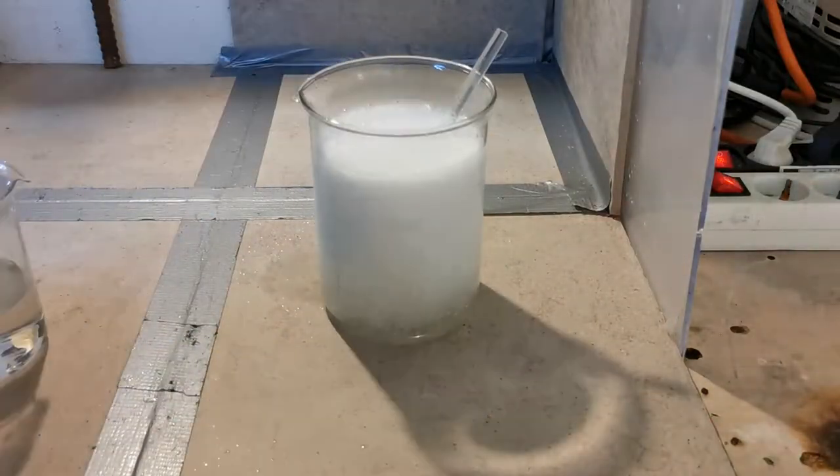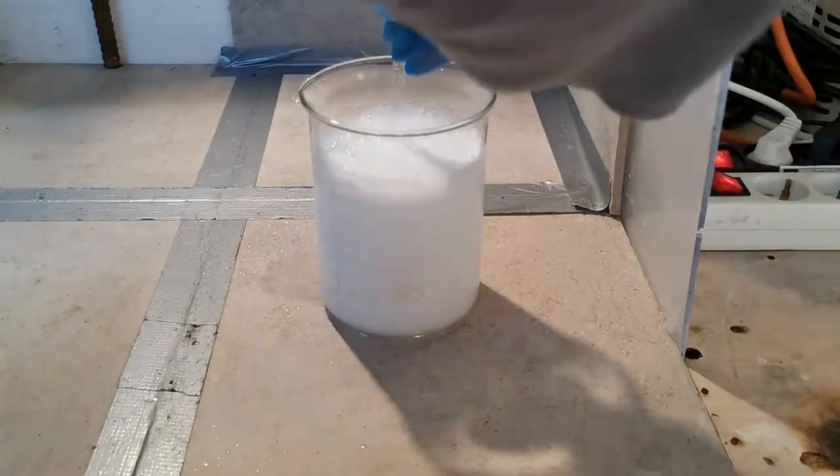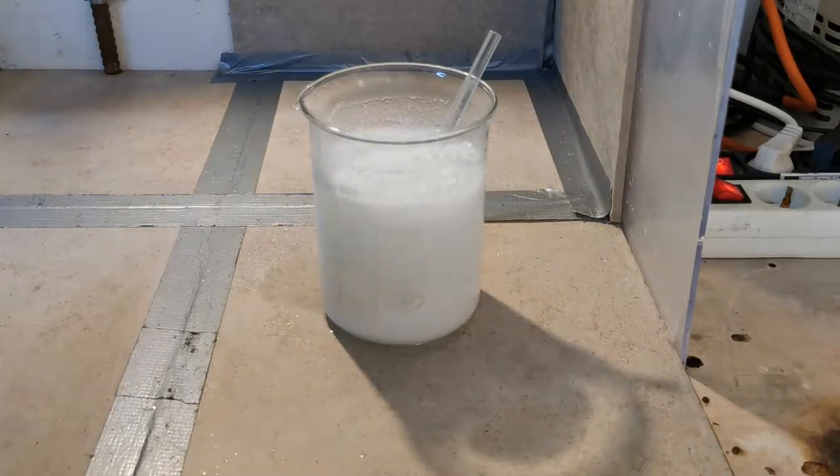Today I will be making some zinc acetate. I will use this to try and make some acetic anhydride via vacuum distillation. If this actually works, I will post a video on it soon.